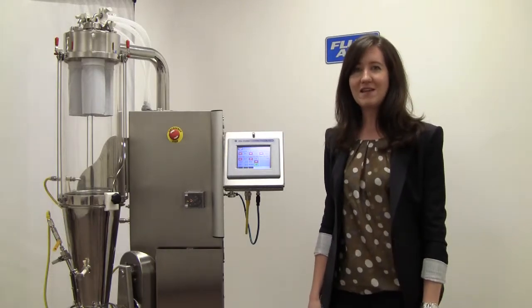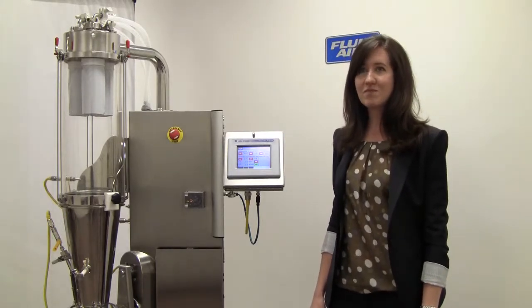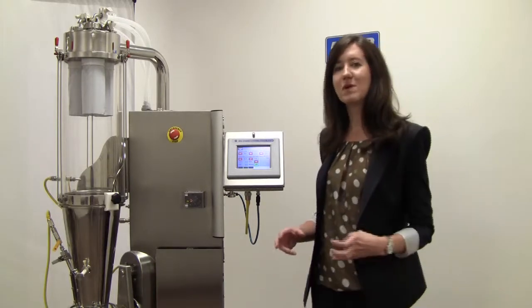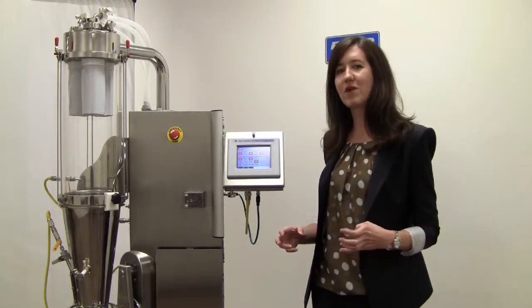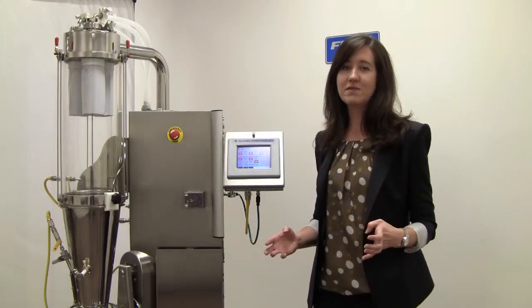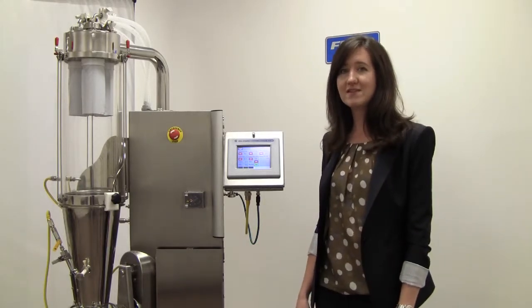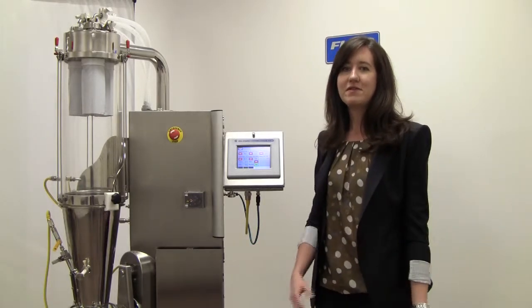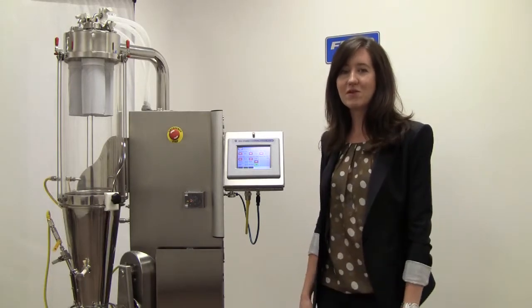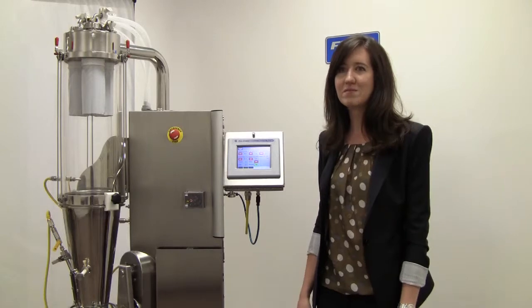If users need more advanced control, they can choose our phase option, which allows them to create phases which represent steps in the process. Each of these phases can be queued up to begin and set the parameters contained in that phase. The system will then proceed through those phases in order and control the system as it's programmed.